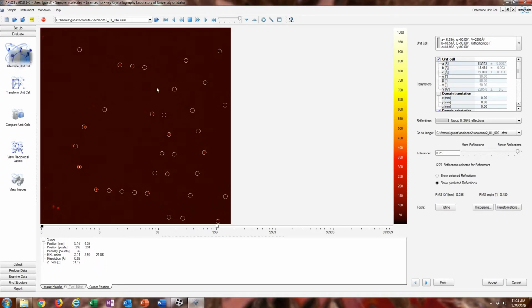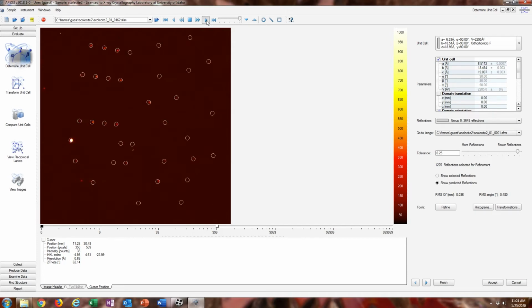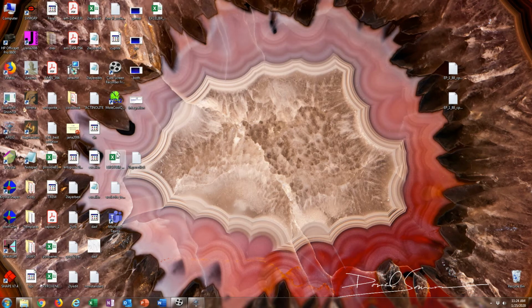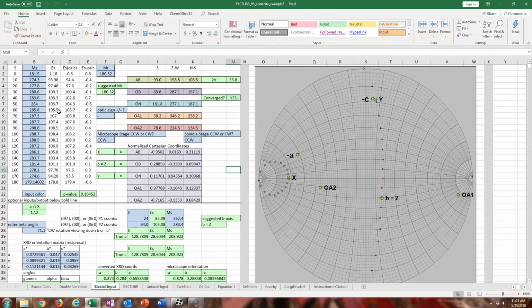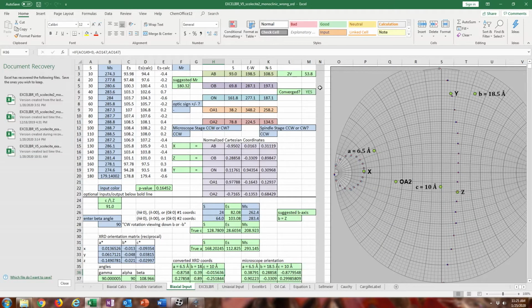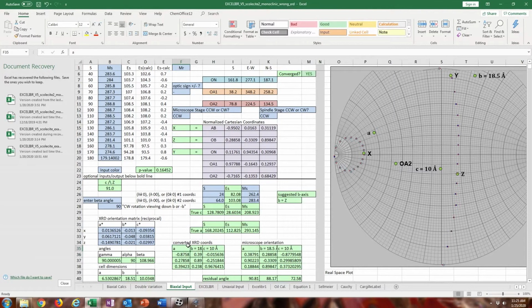So I click refine and it looks good. Everything fits great. But when you go to transformations, here's the orientation matrix for this lattice. And I already collected the orientation from the optical data. So we're going to go to my spreadsheet here. Down here there's the XRD orientation matrix, which is in reciprocal space. That is the same as what you saw listed in Apex3. So if you entered that and tried to relate it to the setting that I determined from the spindle stage, you can compare those two lattices.